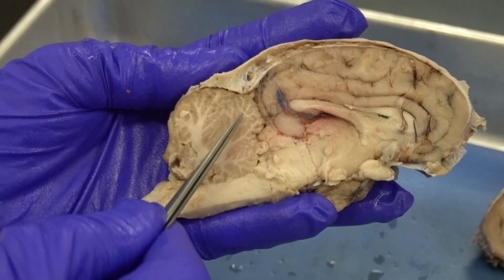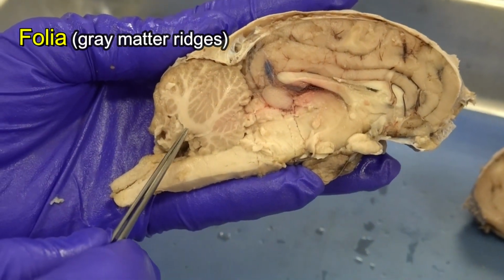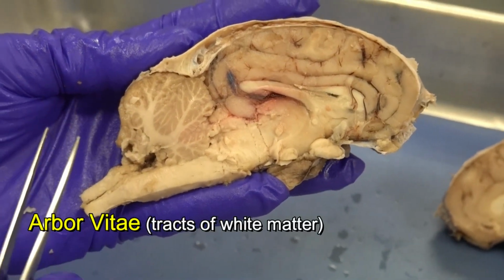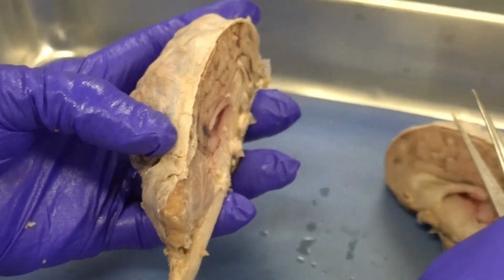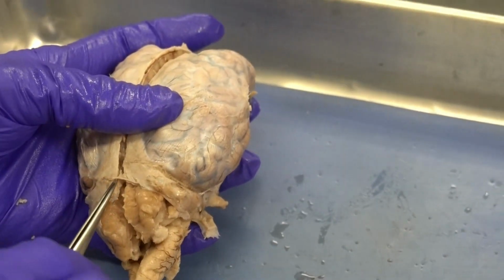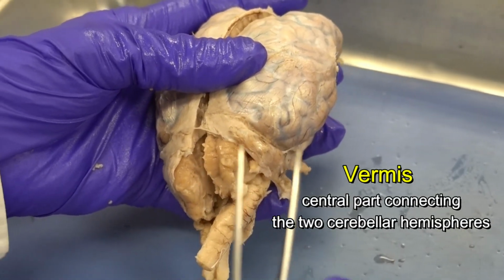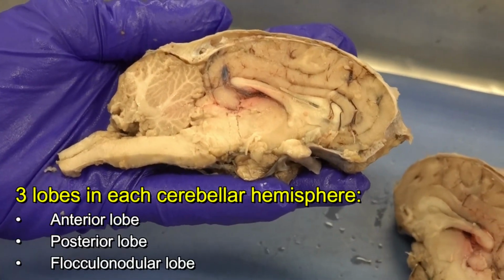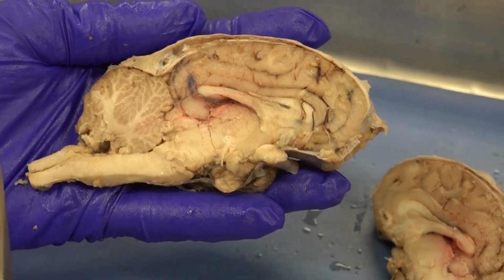In the cerebellum, these elevations of gray matter are called folia, and the white matter that looks like branches of a tree is called arbor vitae. And recall that I mentioned that the cerebellum has 2 hemispheres. If I put the 2 sides back together, you can actually see the 2 hemispheres. The central part that connects the 2 sides together is called vermis. And in each hemisphere, we identify 3 lobes: anterior lobe, posterior lobe, and flocculonodular lobe. So that's a short summary about the cerebellum.